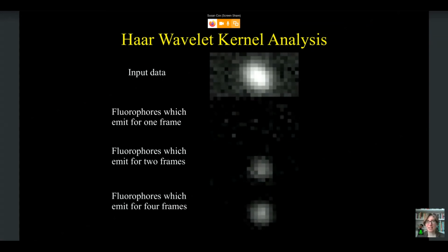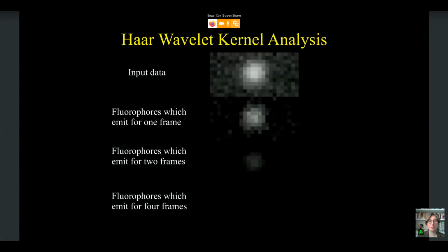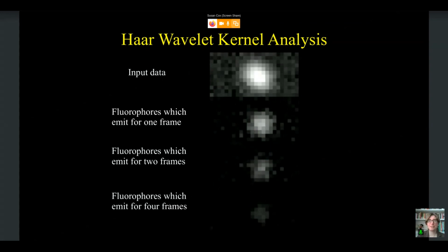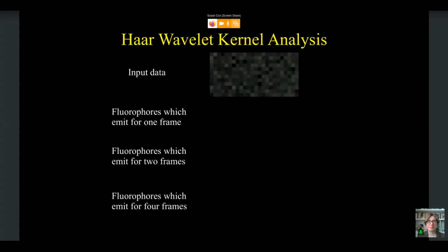where we start out with... I'm just going to wait for the video to start. Here we start out with 1 fluorophore coming on. You can see it appears first in the 1 frame, then the 2 frame, then the 4 frames. The second fluorophore comes on. It then appears in 1 frame, 2 frame, 4 frames.